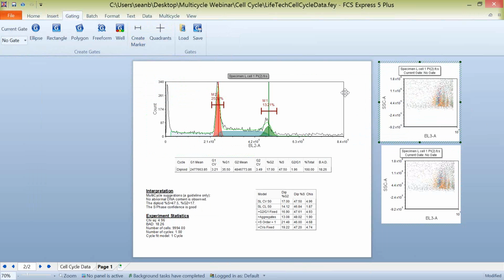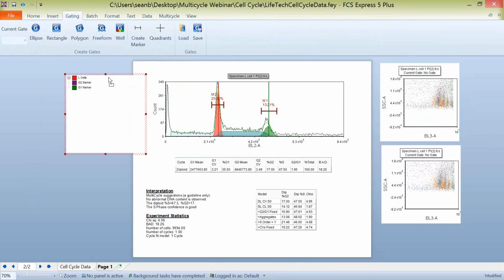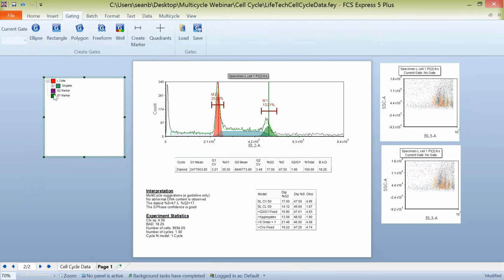And what we can then do is with our gate view or with our gating tab here, you notice that we do have our G1 and G2 marker gates. So if I wanted to apply G1 to our plot on the top and G2 to our plot on the bottom, we can now get an idea of the frequency and the distribution of our BL3 marker as it applies to our G1 and G2 populations. Again, we're not accounting for the overlap between S phase and G2 with our markers. That's all being defined by the modeling.